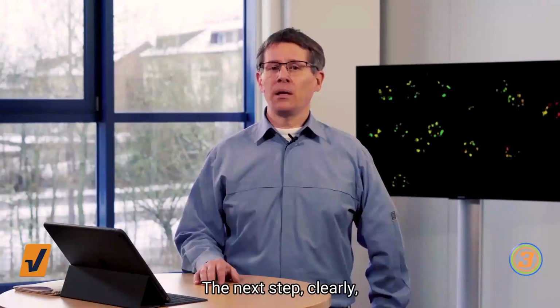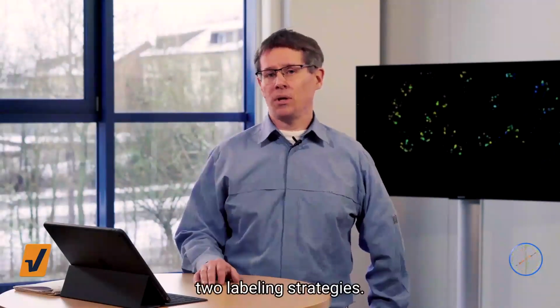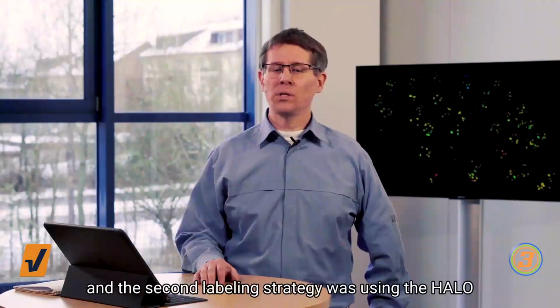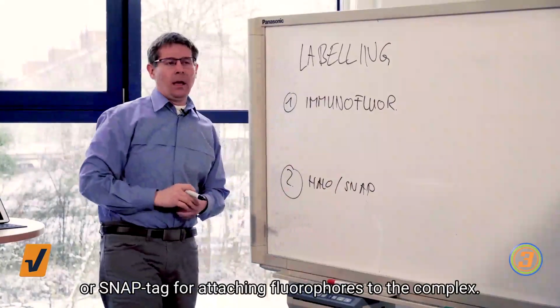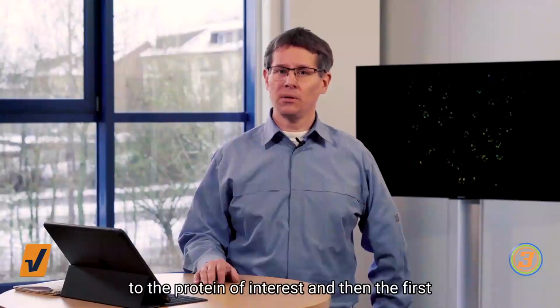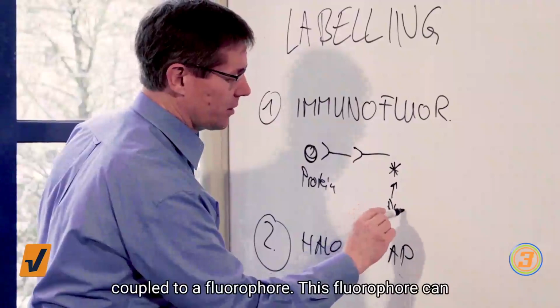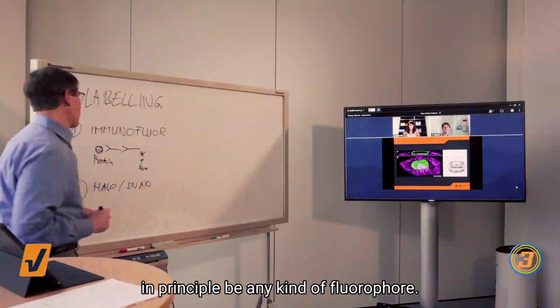The next step clearly was to optimize the labeling strategies for nuclear pore complex labeling. And we considered here mainly two labeling strategies. First was classical immunofluorescence labeling, and the second labeling strategy was using the Halo or SNAP tag for attaching fluorophores to the complex. The use of immunofluorescence labeling is based on the fact that you're having an antibody binding to the protein of interest, and then the first antibody is detected with the secondary antibody coupled to a fluorophore. This fluorophore can in principle be any kind of fluorophore.